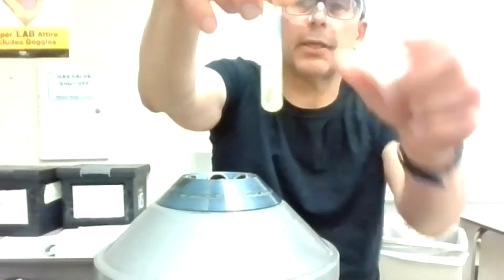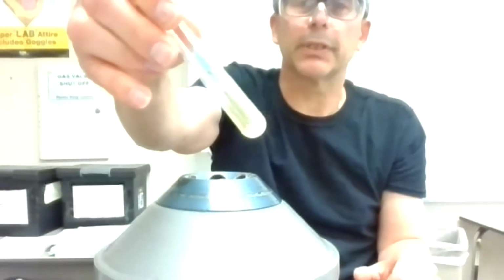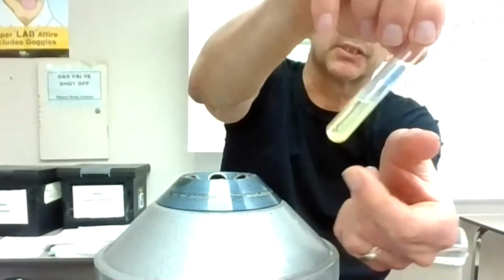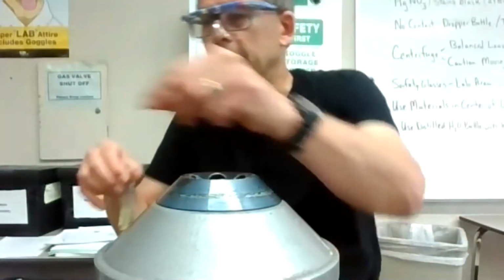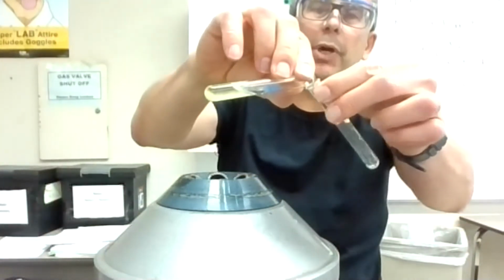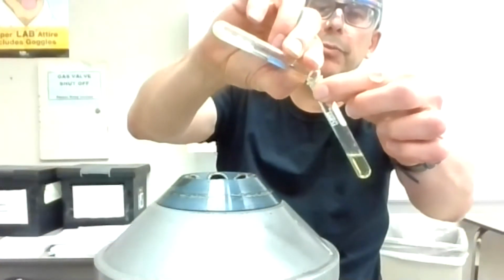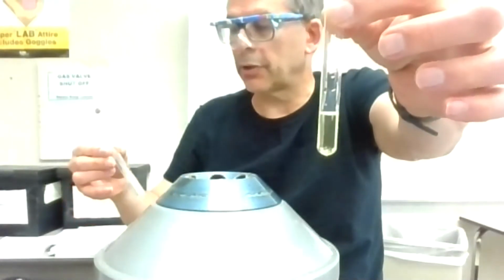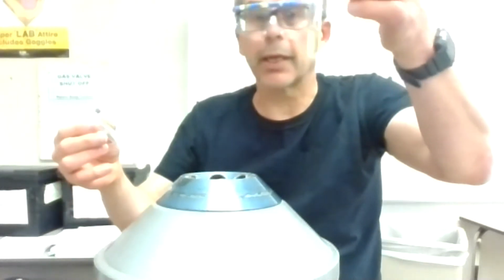Okay, so you can see there's stuff at the bottom. I don't know if you can see that well, and then it's kind of frosted on the side of the glass too. So as it gets centrifuged, it's facing this way. So this side of the glass doesn't get painted like the bottom does because of the angle that this thing is in the centrifuge. Okay, that's one that's kind of harder to clean up, but I'm going to transfer this to a new test tube and hopefully have a nice clear solution, some yellow color tint in it, but that's about it. Ready to go to the next thing.